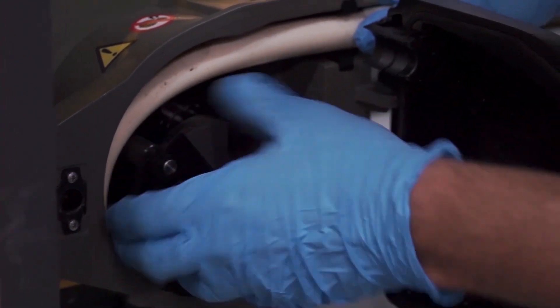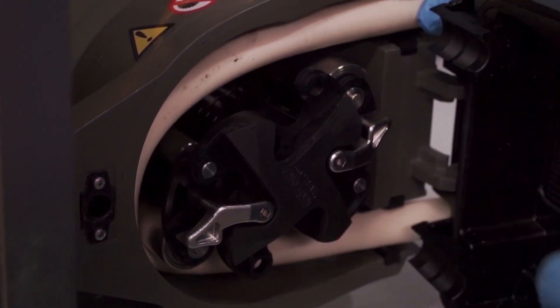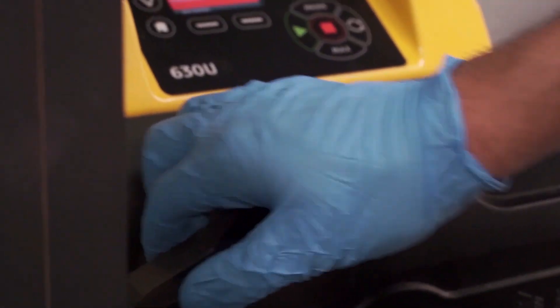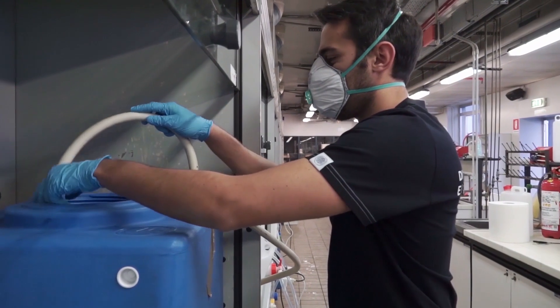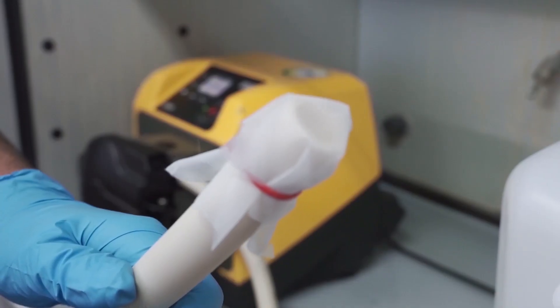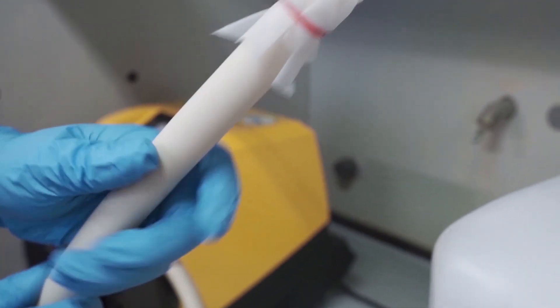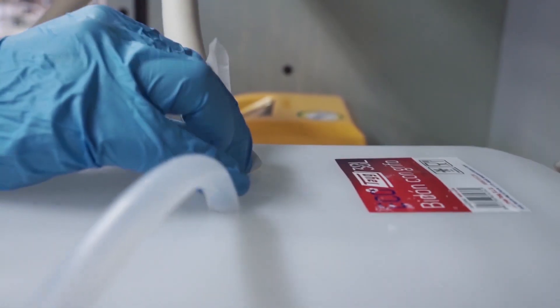Regarding the alcohol flow, it is necessary to position the tube inside the pump, check that the flow direction is set correctly, verify that the suction tube reaches the bottom of the alcohol tank to avoid air flow, insert a filter at the outlet of the tube to prevent the dragging of parts of the tube that may have been damaged by the alcohol, and control the correct flow rate of the pump.